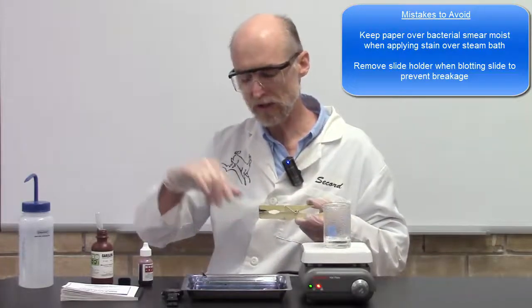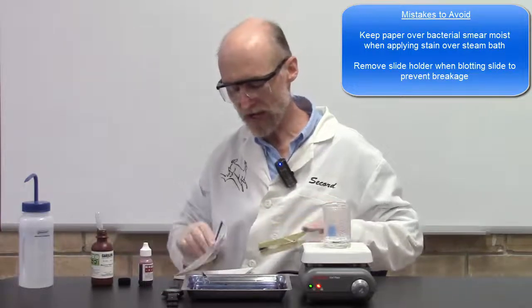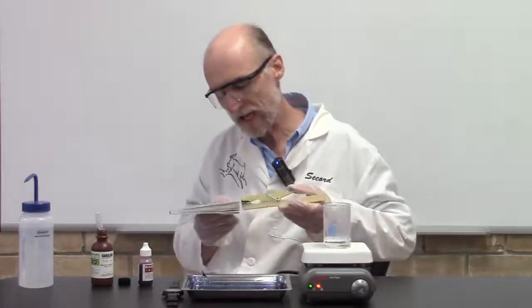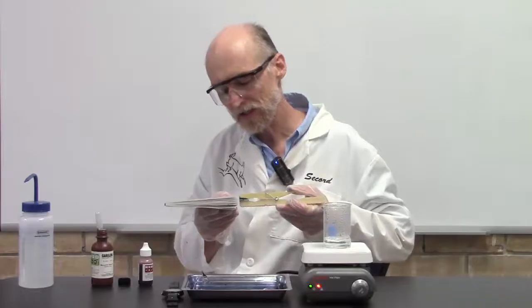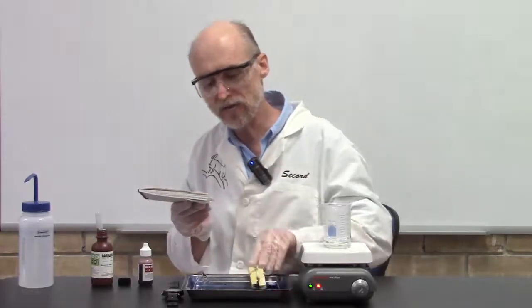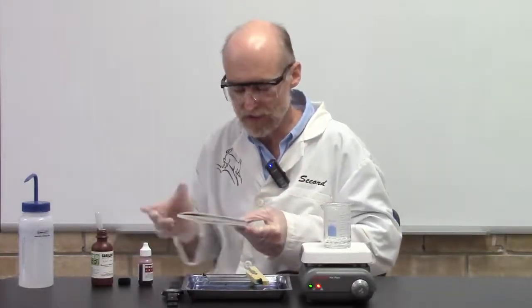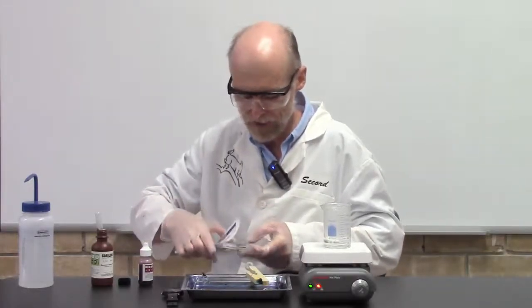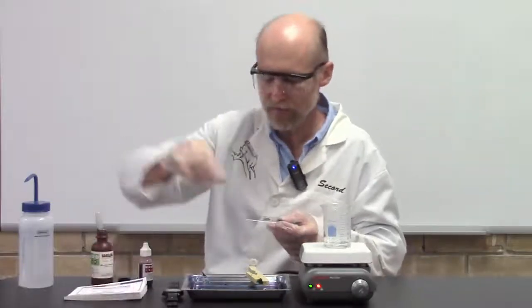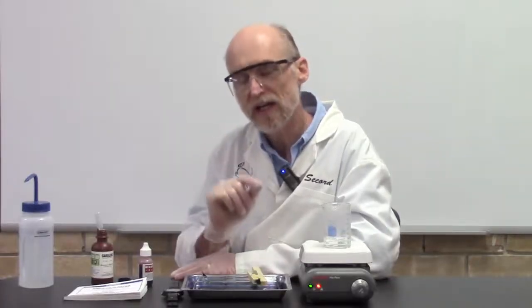Don't hold it in your slide holder while you blot it dry, because what will happen is a lot of times you'll get an angle on it and you'll snap it. When I put it in here, I went ahead and took the slide holder off, and that way it keeps the slide flat and prevents it from breaking. There's the technique, so give it a try. And what you're looking for is the spores will be green and the bacterial cells will be pink.